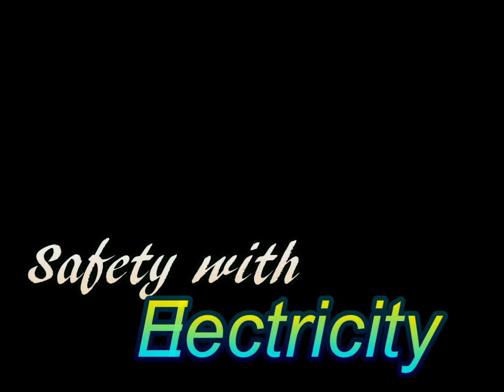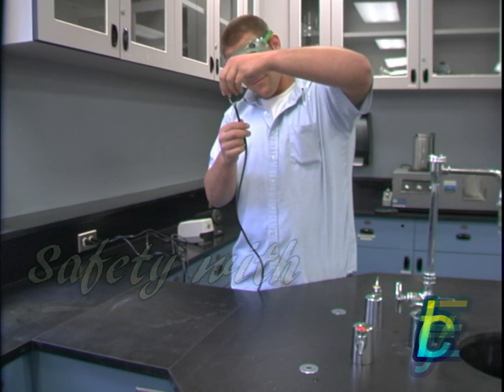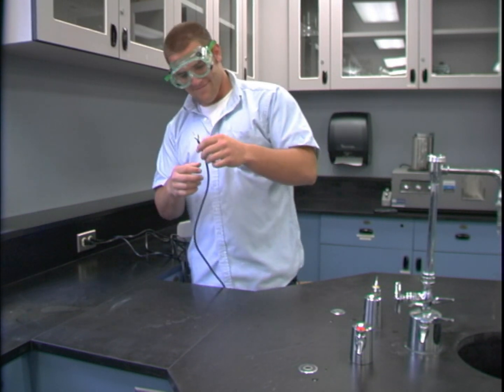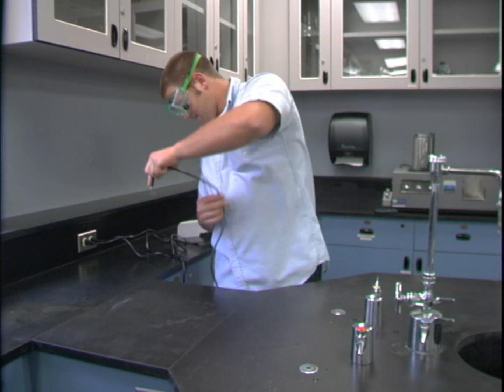In my time, I've seen what electricity can do to a person. It can kill them, and it can also bring them back to life. But for us, it is better if we stay away from running electricity through our bodies. Never use equipment with frayed cords and loose or broken wires. Never touch electrical equipment with wet hands or use equipment near water.